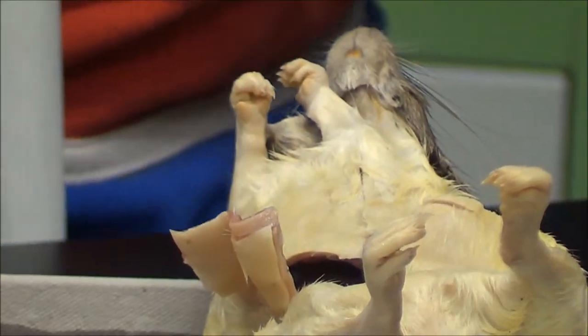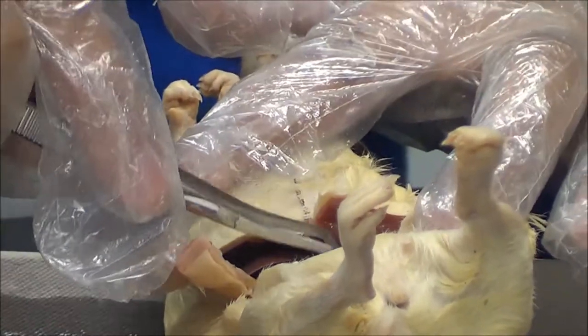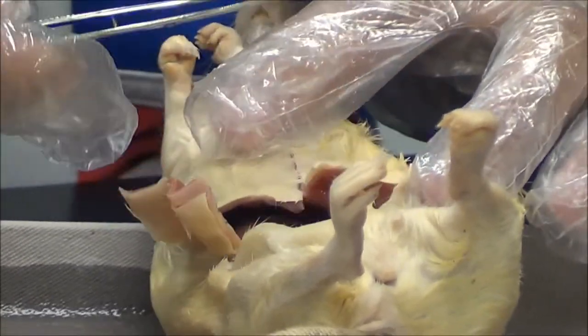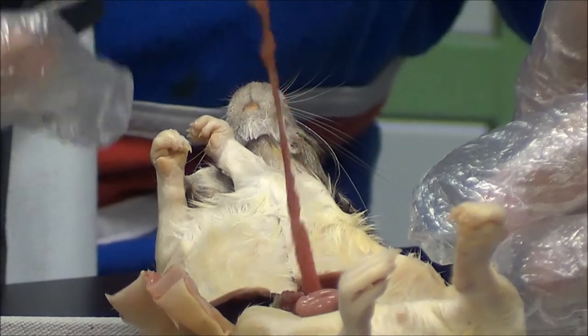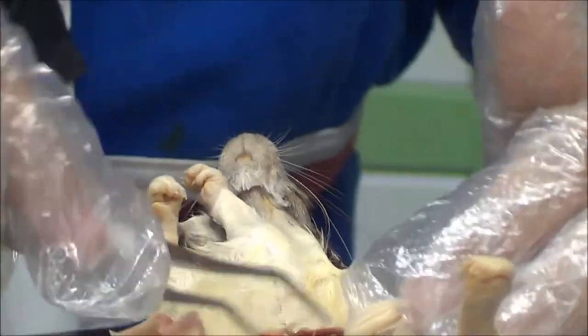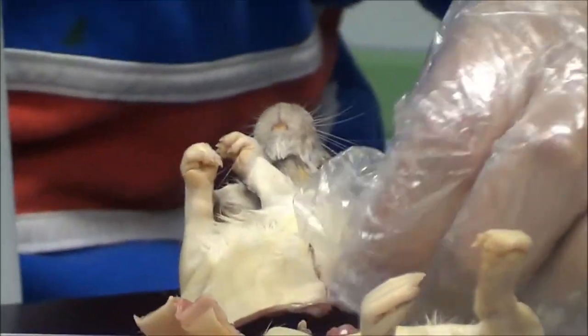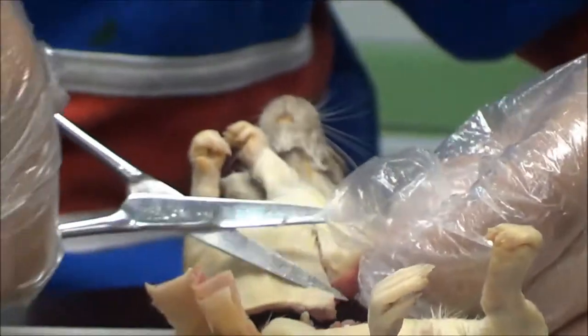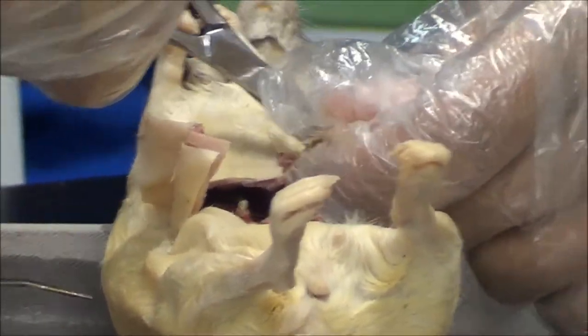From this part you will be able to see the stomach and the small intestines, which by effect is exactly 1.3 meters long. If you cannot still have access to the liver or stomach, make an extra cut by the neck with the scissors.